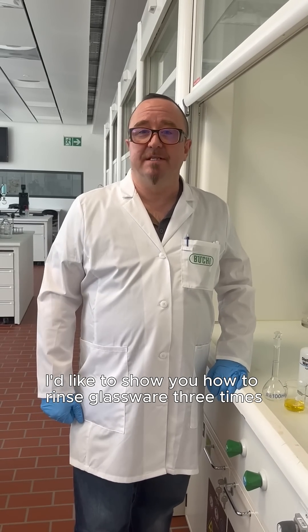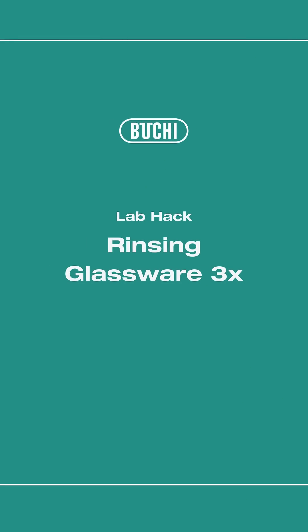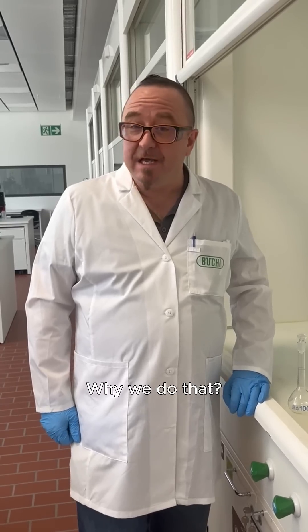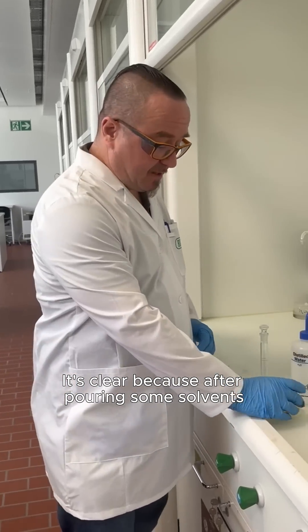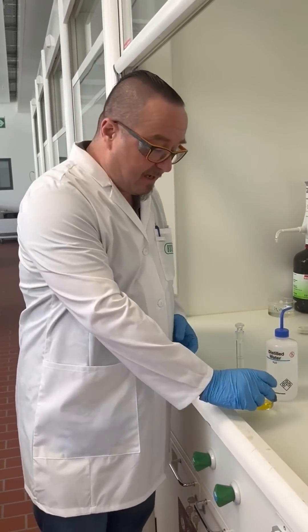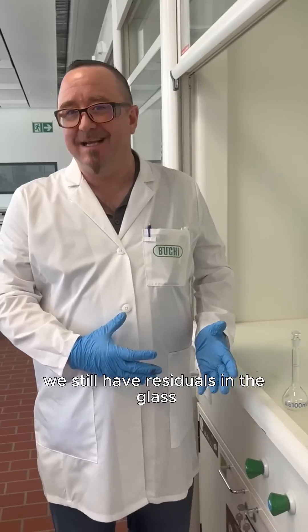I'd like to show you how to rinse glassware three times. Why do we do that? It's clear because after pouring some solvents, we still have residuals in the glass.